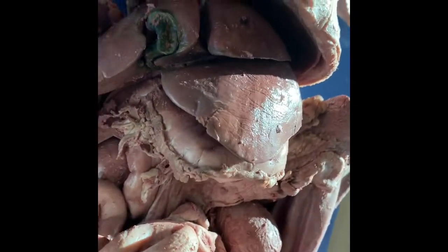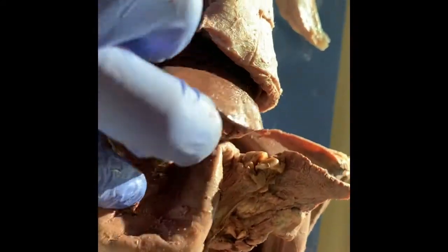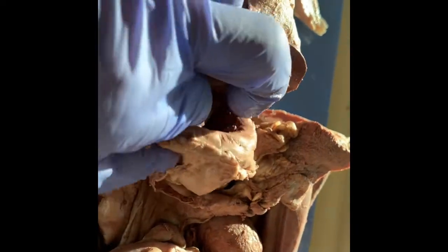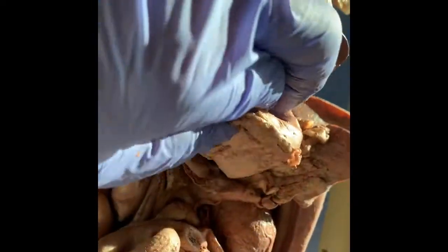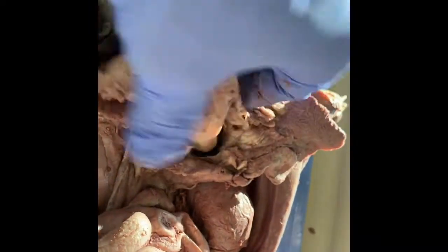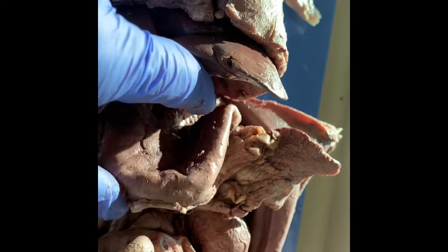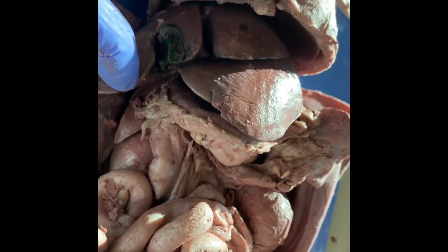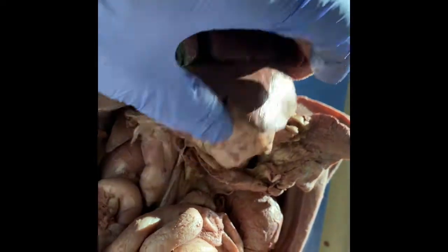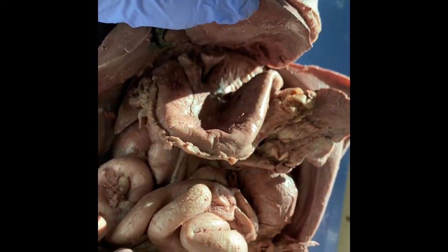Okay, so now you can see the intestines. The first thing we're going to do is pull out the stomach, and then I'm going to do a butterfly cut, and we're going to look at the contents of the stomach. It's pretty flaccid, so there's not much in here. Oftentimes it's totally inflated and the cat had a big old meal as its last meal. But give me a second. I'm going to pull this out and remove it, and then we can check out what's inside.